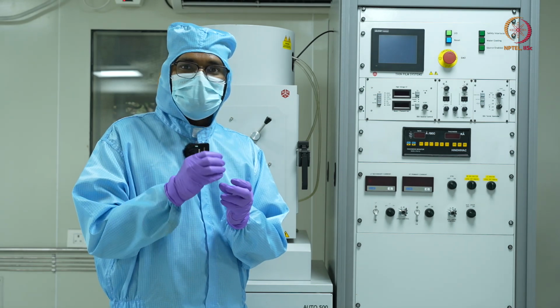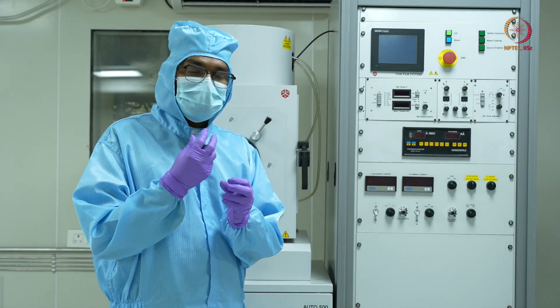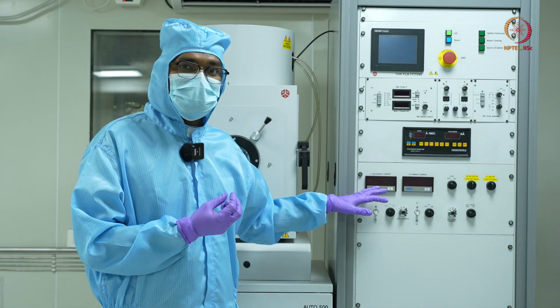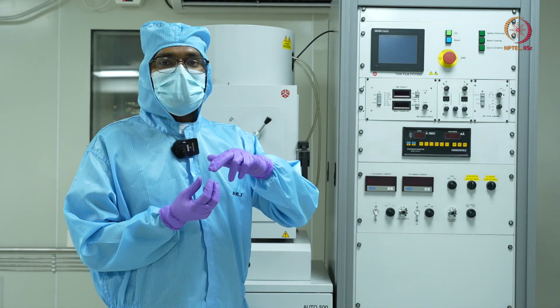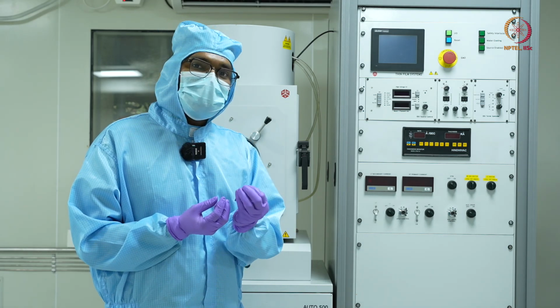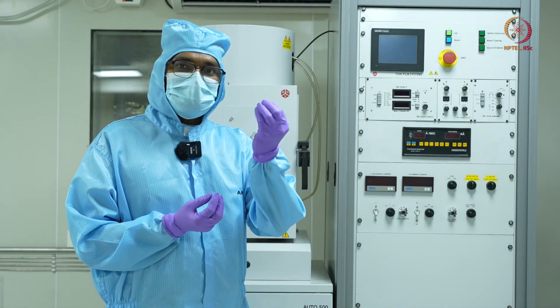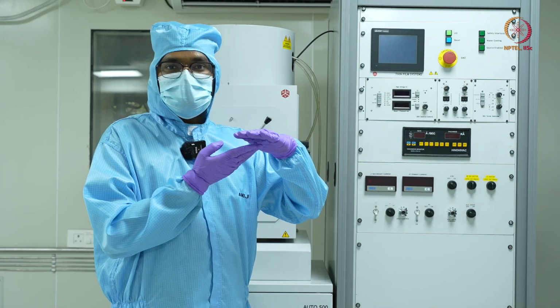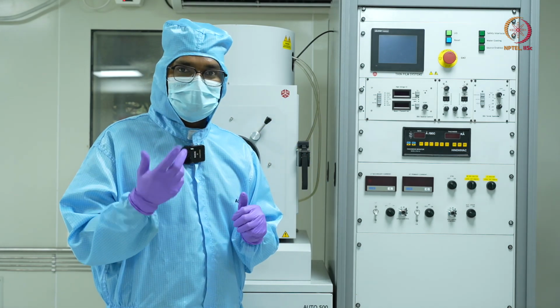If the conditions, such as the vacuum, that is the pressure, and the temperature are sufficient, it will start evaporating, and these source material vapors will go and settle down on my substrate, and that's how I'll get my deposition.